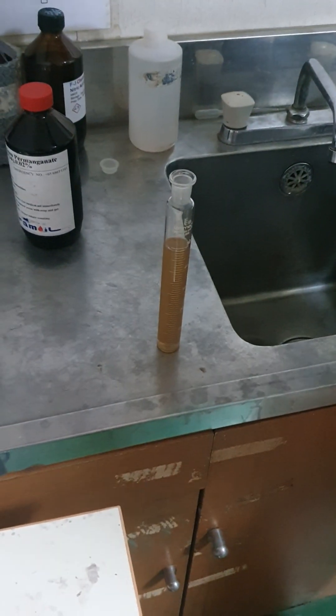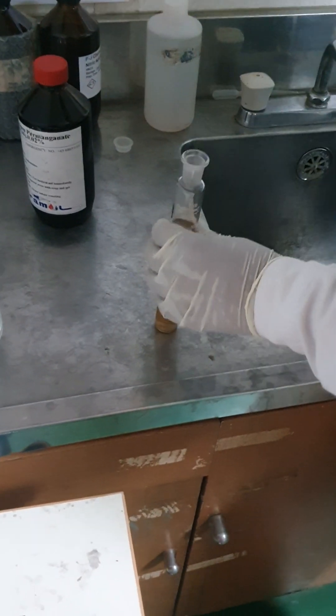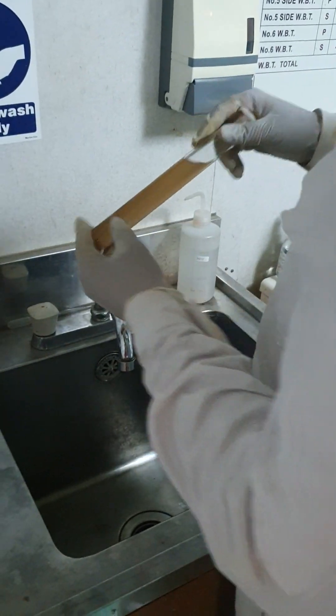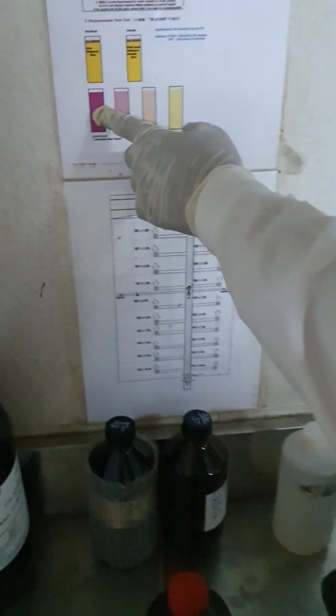And then you will need to, after you prepare this one, you need to close the cap and then you need to put it in the refrigerator. And then you will compare after 50 minutes, this color is changing or not.